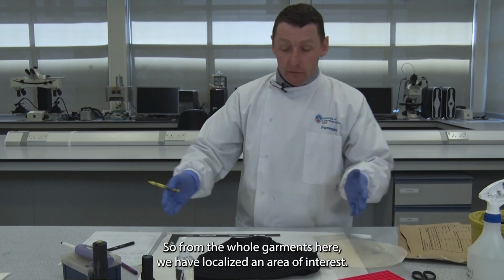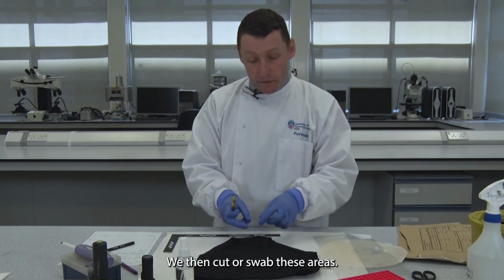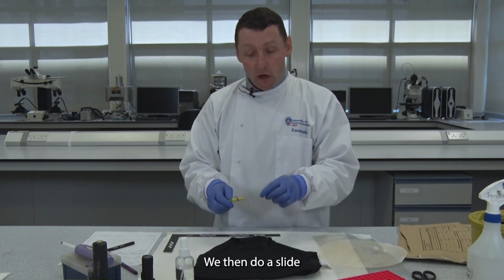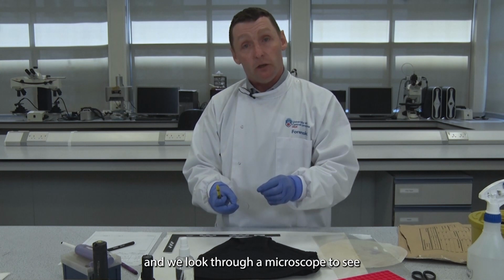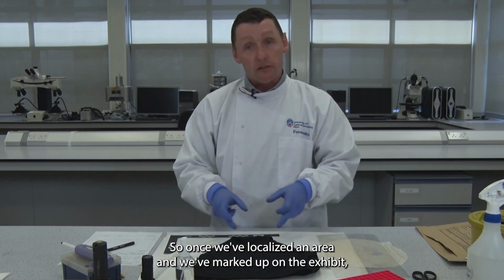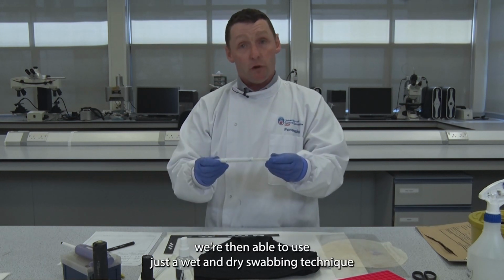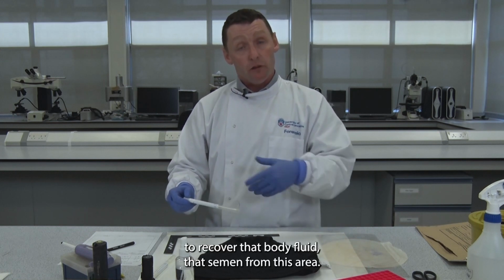So from the whole garment here we have localised an area of interest. We then cut or swab these areas, and we then do a slide and we look through a microscope to see if we can actually see sperm cells. So once we've localised an area and we've marked up on the exhibit, we're then able to use just a wet and dry swabbing technique to recover that body fluid, that semen, from this area.